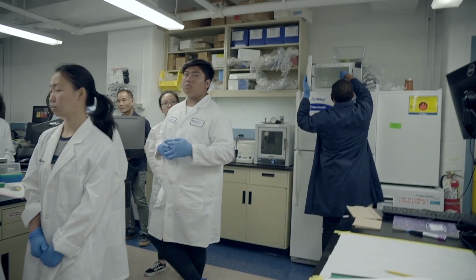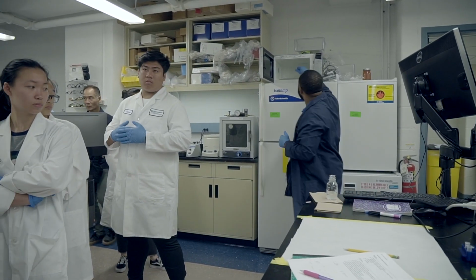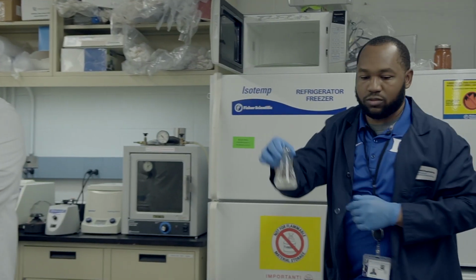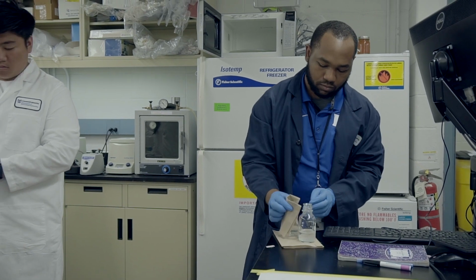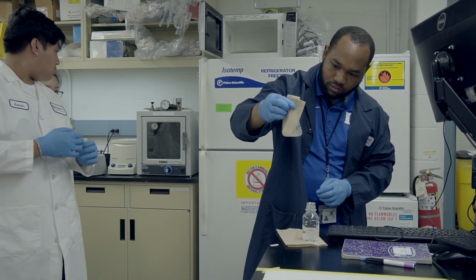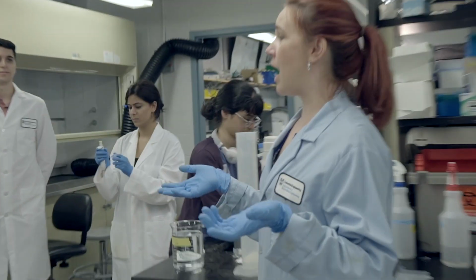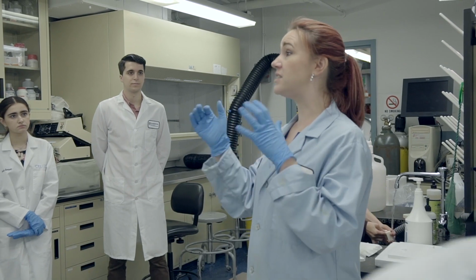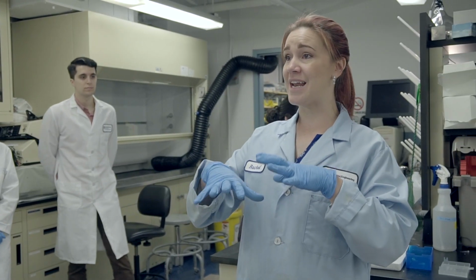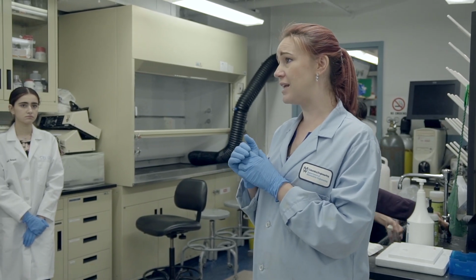And did you guys go over here what the SYBR Safe does? So why are we adding the SYBR Safe? Do you know why we do that? What color is our DNA right now? It's clear, right? So how are we going to see it once we run this gel? Like how are we going to be able to visualize it? We need to add something that will stick to that DNA so that we can visualize it. And we're going to use UV light to visualize it.